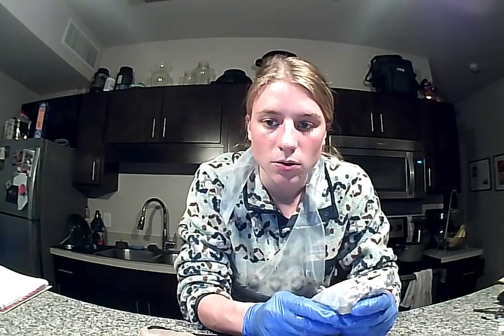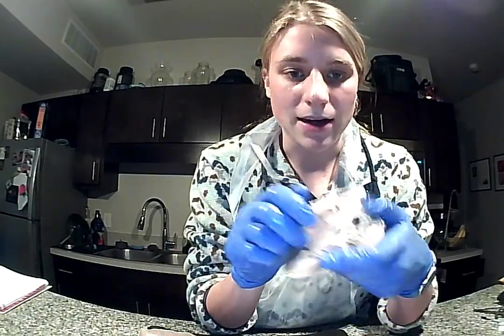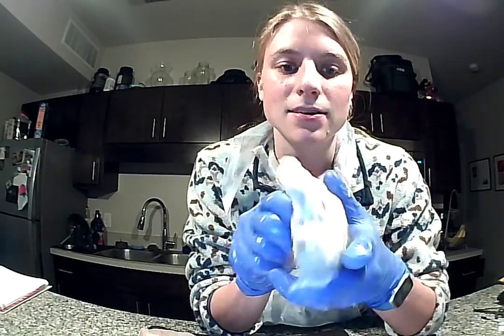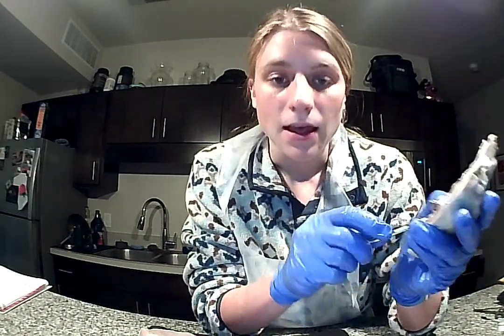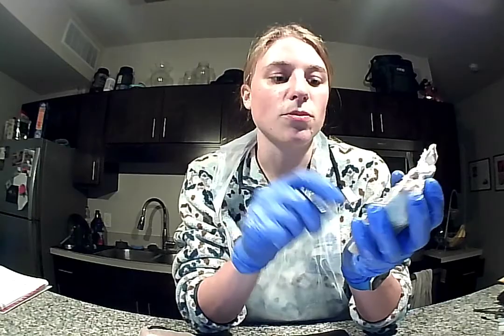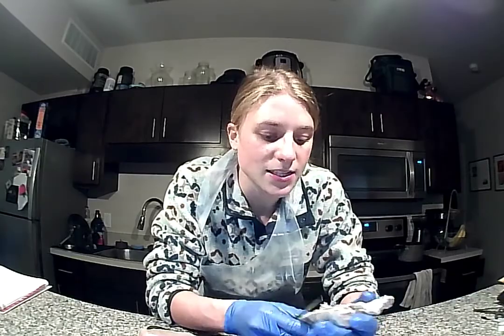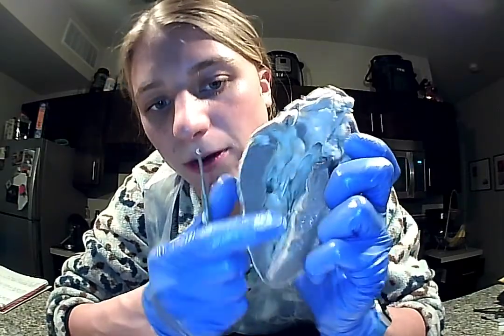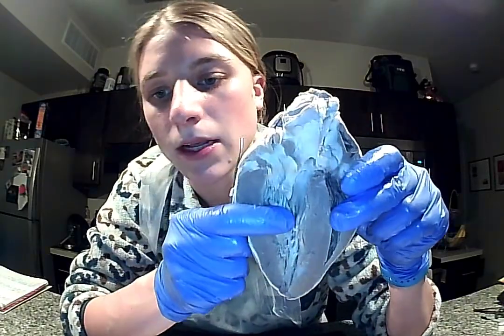So next, what we're going to talk about is the ventricle. So we're back down at our left ventricle. And what happens is blood's going to exit that left ventricle through the aortic valve and then into the aorta. And this will pump that oxygenated blood through the rest of the body. Some other features are going to be the interventricular septum. So that is this right here. And that is what is going to separate the two ventricles, the left and right ventricle.